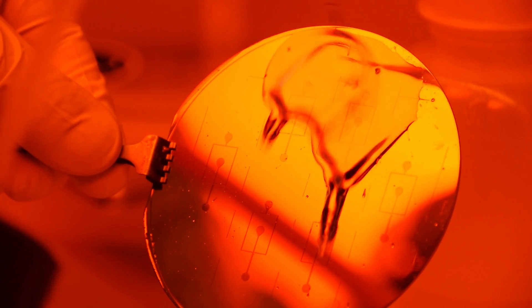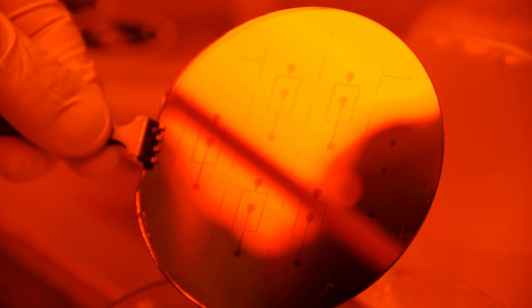We light it up, take the resin back out, heat it up and develop it. We get rid of the non-lit up parts with the solvent. We clean it and the mold is ready.